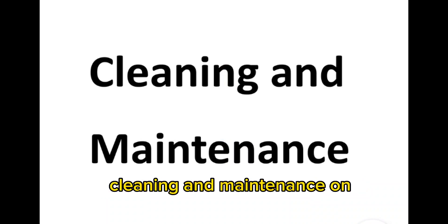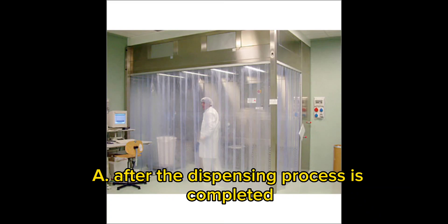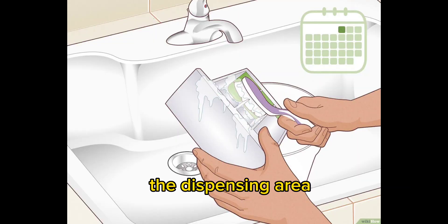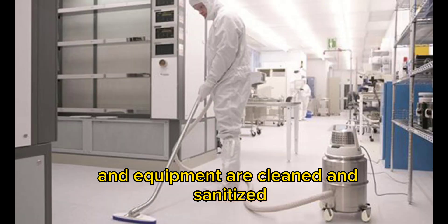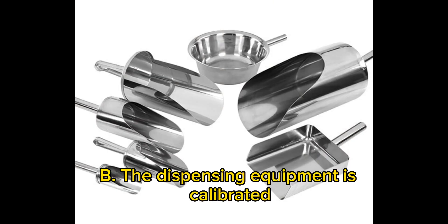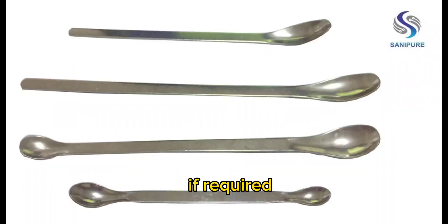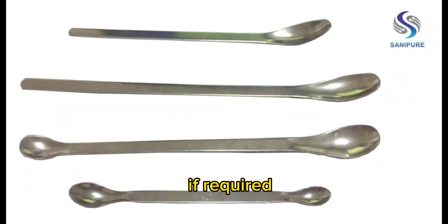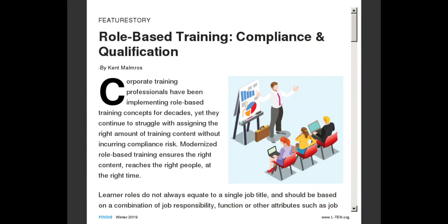Cleaning and maintenance: After the dispensing process is completed, the dispensing area and equipment are cleaned and sanitized as per the established procedures. The dispensing equipment is calibrated if required and maintained in good working condition.